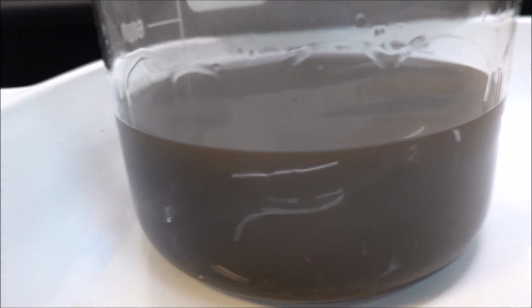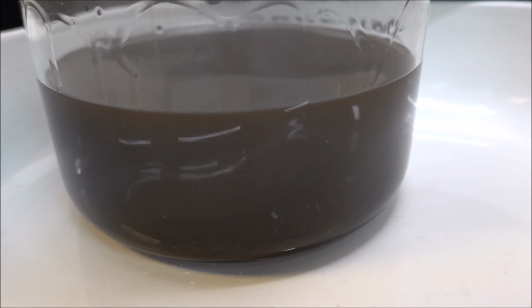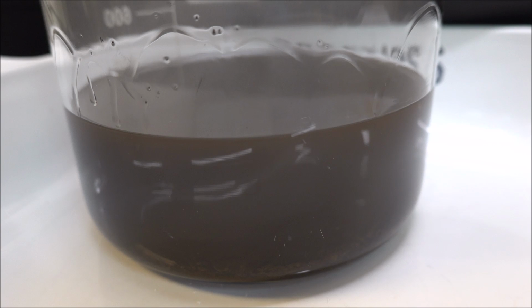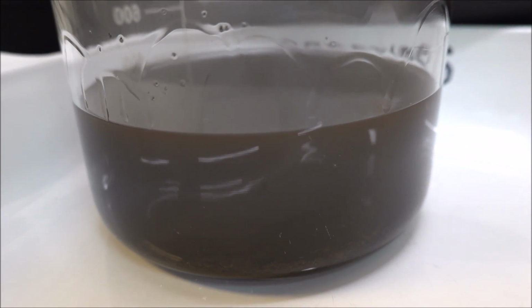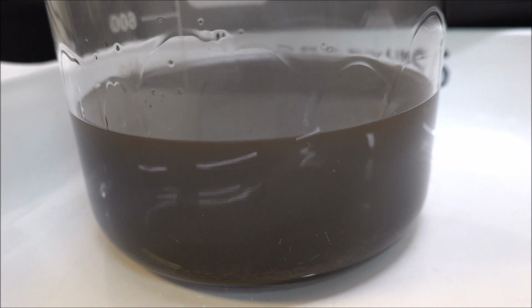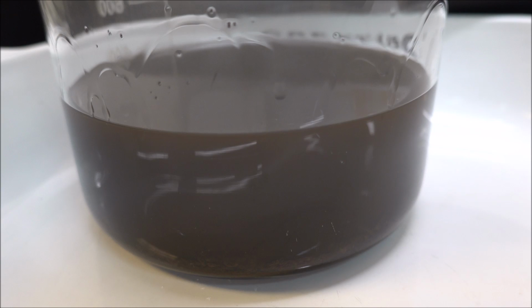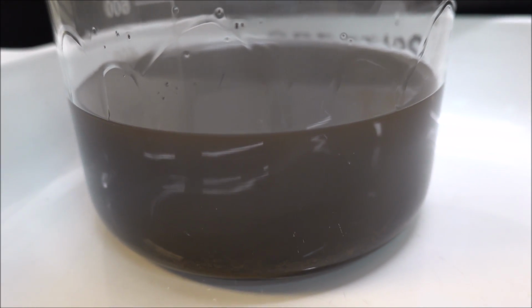And this is why it's important to make sure that we add the correct amount of metal to inquart our gold. Adding too much will cause the gold to crumble and form a powder and make separation of liquids difficult.